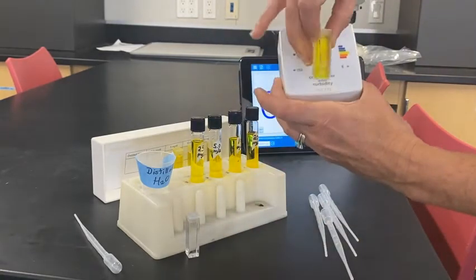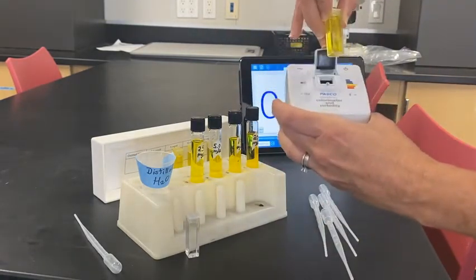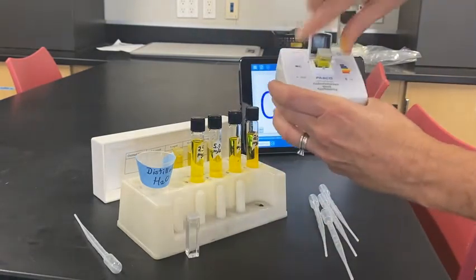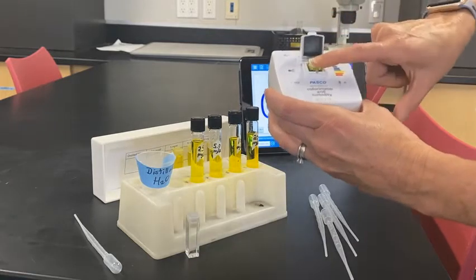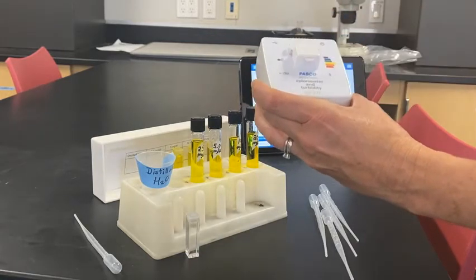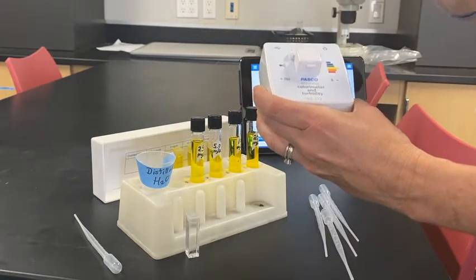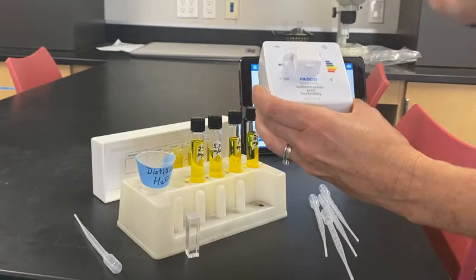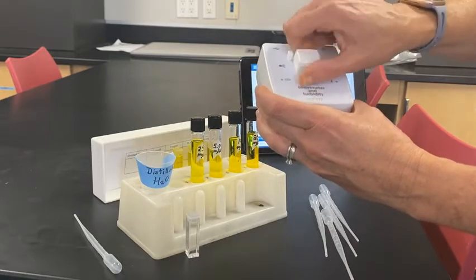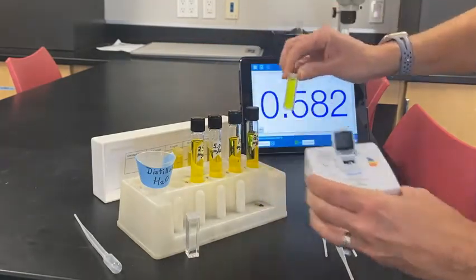It's very important that you put in the smooth side so the light can go right through. Here's how you do that: you open the lid, push the cuvette in, then close the lid, and the light will shine through and you will get a reading.